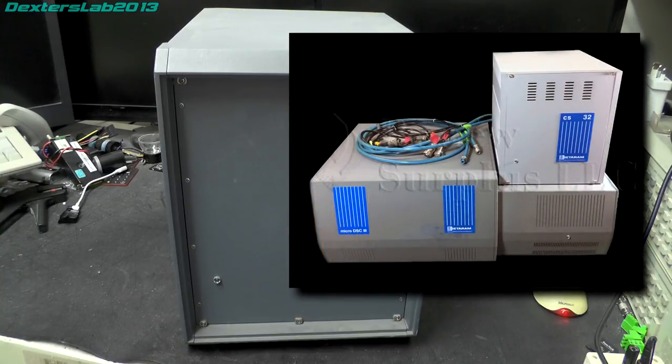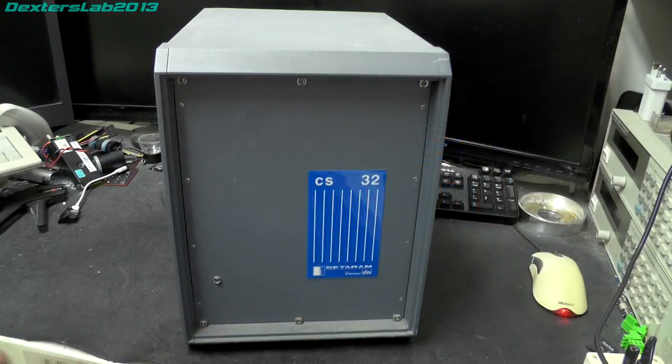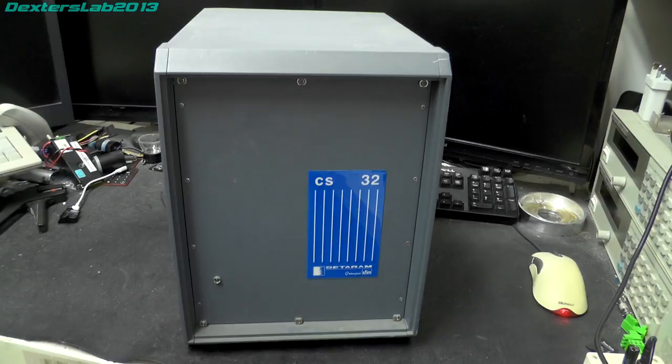The science element, which is a large calorimeter, would have been attached to this, and it seems that this box here is a processing controller that connects with the science elements, and then a PC connects to this to actually get some data out of it.